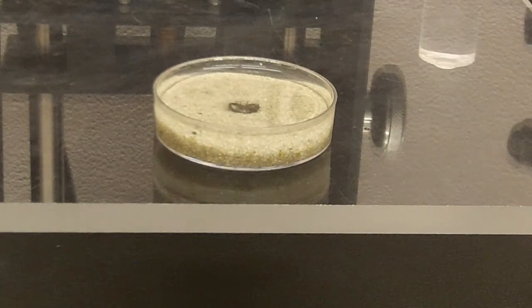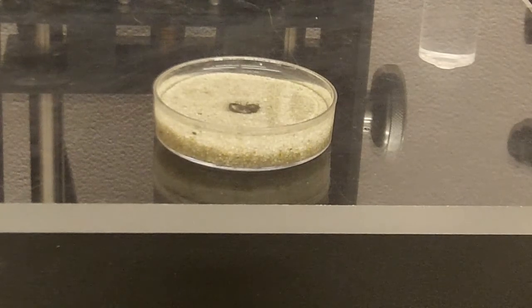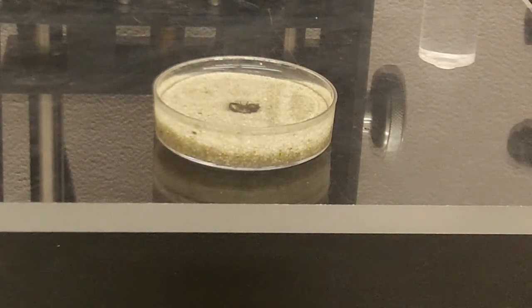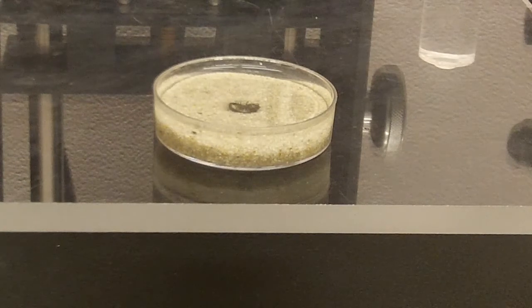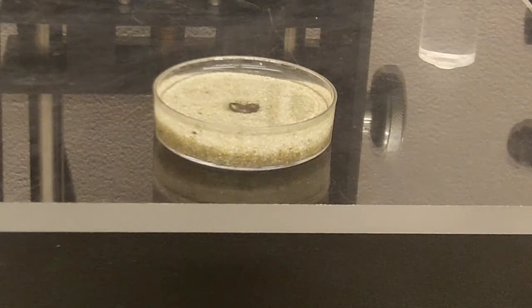A note: if you do add any ethanol to the petri dish, make sure that if you are doing this near your camera, that the lens cap is on so that there's no risk of splashing the lens.